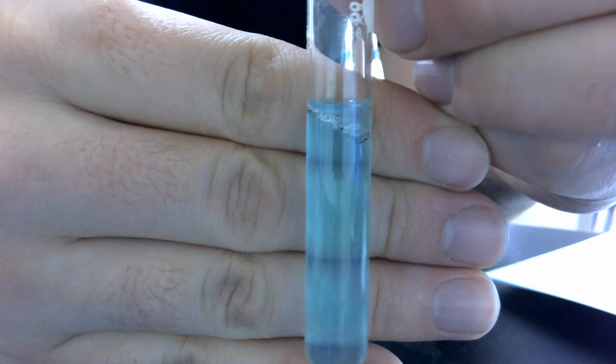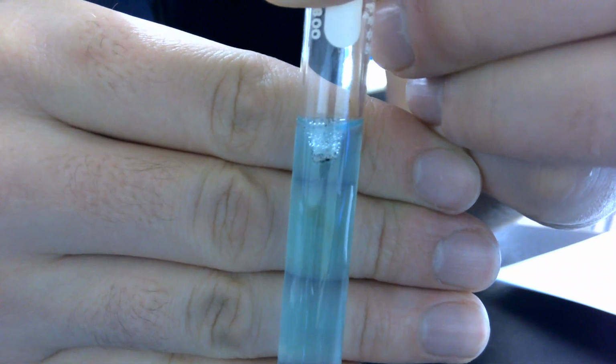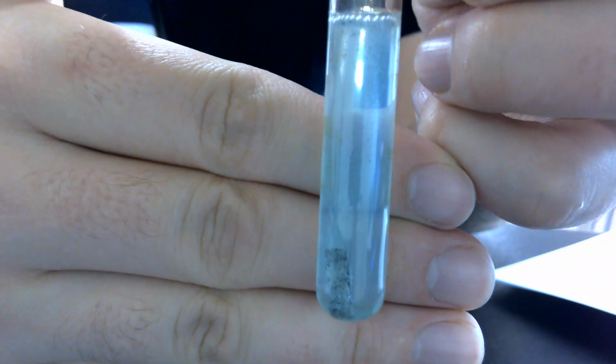So we're going to try to avoid getting too much of that powder in here, but we're going to put that into here and see the reaction that takes place. I'm going to leave it there. Let's see if I can get that focused. Bubbling up. There we go. You can see it kind of bubbles. That's why it's floating actually. Shake it, it'll go down. You can see it leaves a couple of floaties.